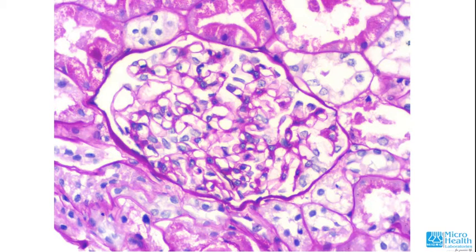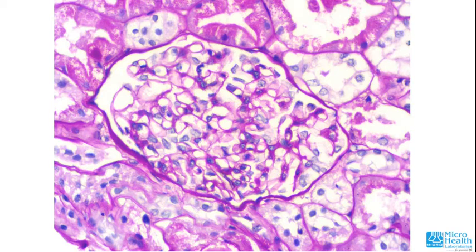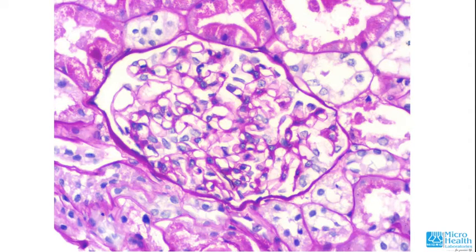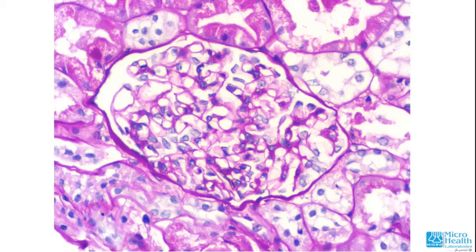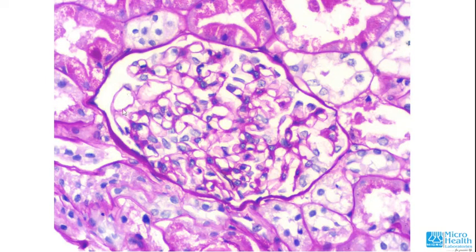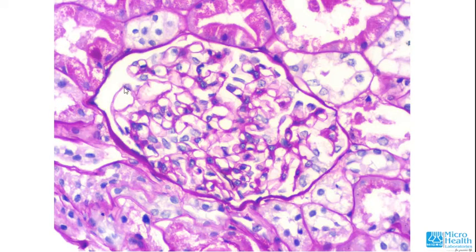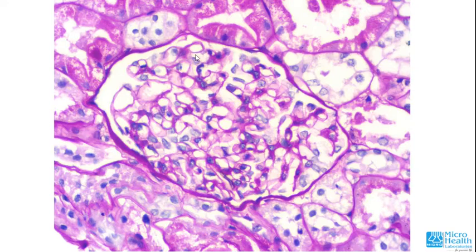The mesangium is a supporting structure of the capillary loops; if there is any defect in the mesangium, the capillary loops will swell up or form aneurysms. The capillary loops are formed by branching of afferent arterioles, which come from the interlobular arteries. After entering the glomerulus, they divide into numerous capillary loops, which later coalesce to form the efferent arterioles. Blood in the capillary loops is ultra-filtered, and the ultrafiltrate forms the urine in the urinary space.